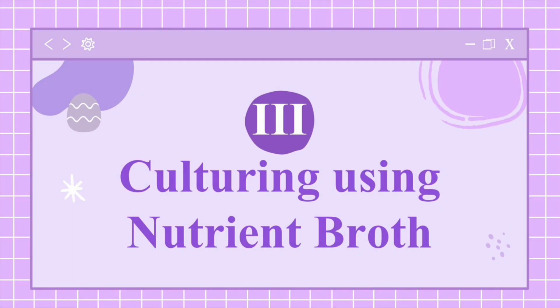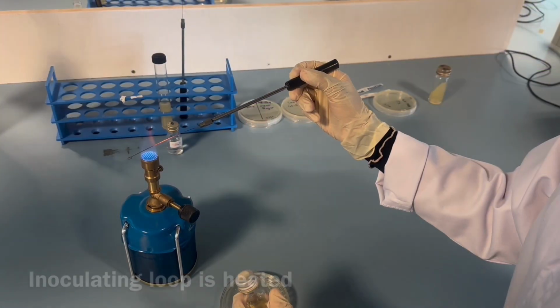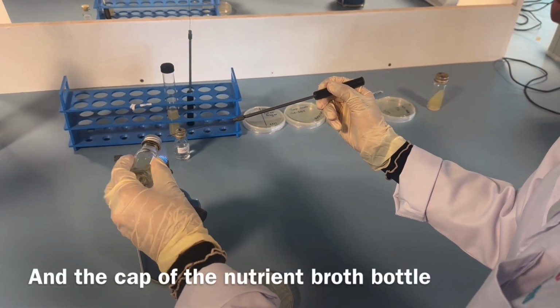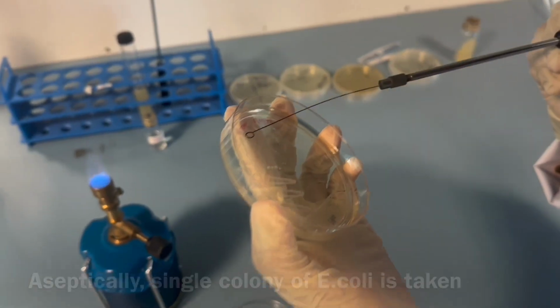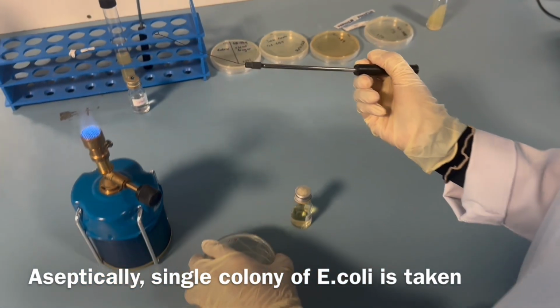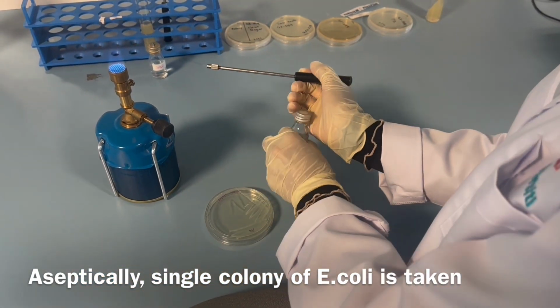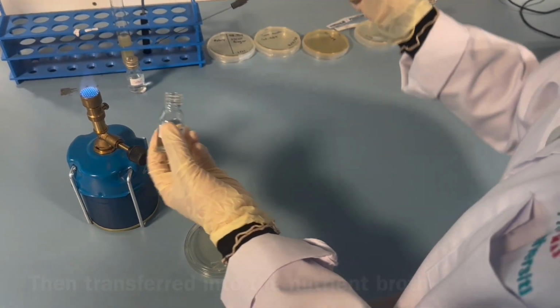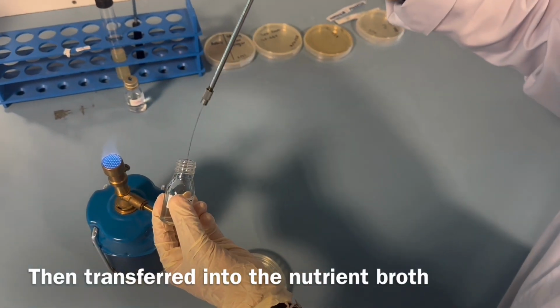Moving on, culturing using nutrient broth. So here the inoculating loop is heated and the cap of the nutrient broth bottle. Aseptically, a single colony of E. coli is taken then transferred into the nutrient broth.